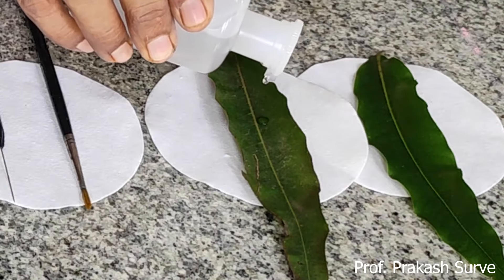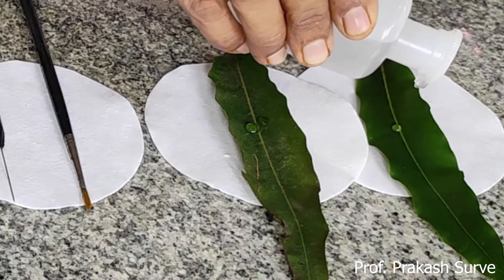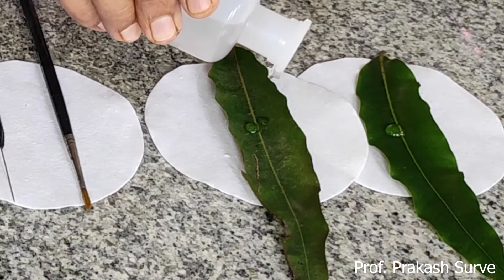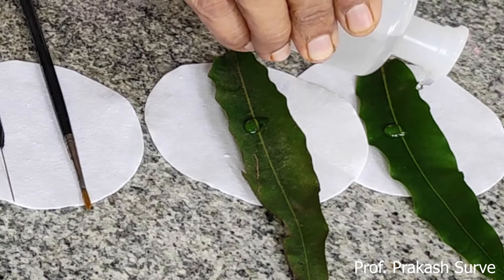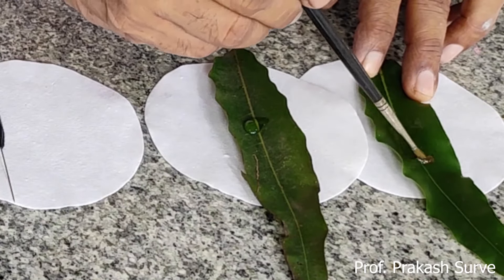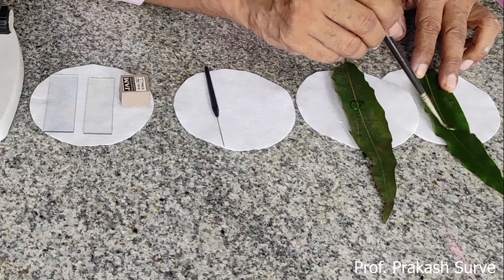Now I will take the glycerin and put four to five drops on each leaf. The reason for using glycerin is that it does not dry out. We will apply it to the washed leaf as well. After placing the glycerin on the leaf, we use a clean brush to spread it throughout the surface of the washed leaf.